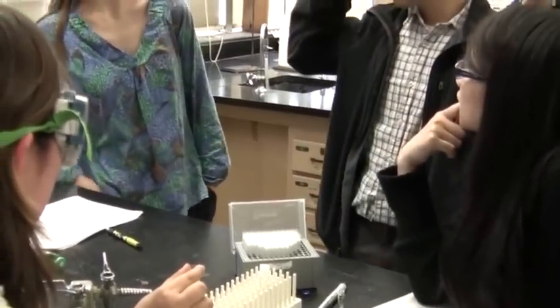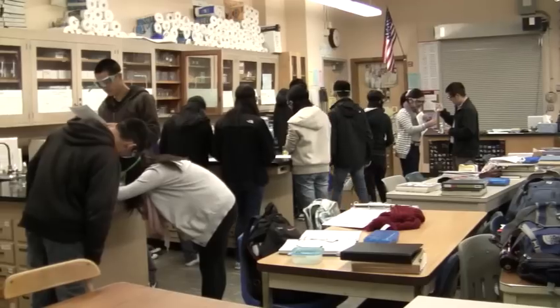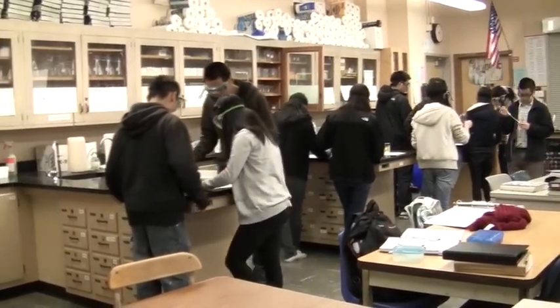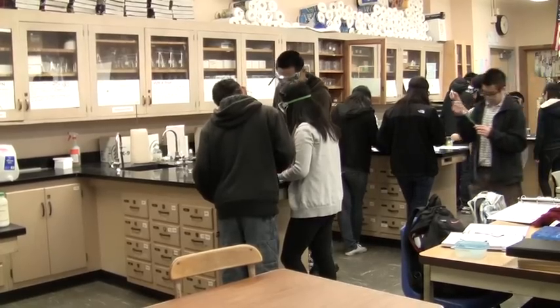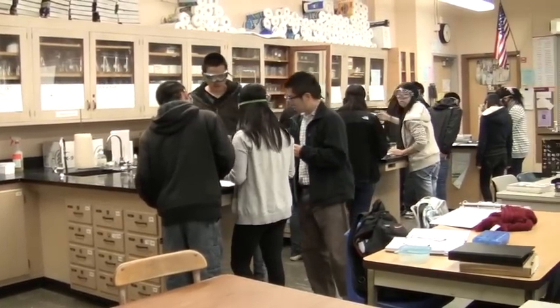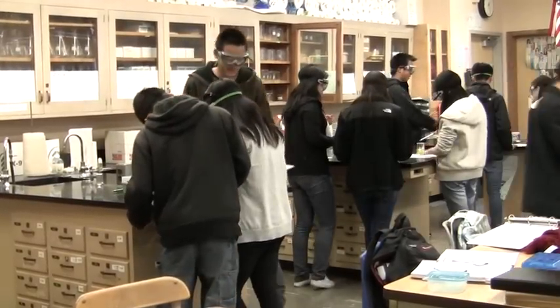My students are very interested in what's going on — why does the isopropanol separate on the top as opposed to the soft drink being on the bottom. They can relate the density of those two liquids, and they know where the caffeine goes: it goes to the isopropanol because of intermolecular forces or polarity. Just being able to have that light bulb turn on and make those connections between what they've learned in the textbook and what they've been taught in class is powerful — even though they might not physically see what's happening on a molecular level, they know this is really what's happening based on their prior knowledge.